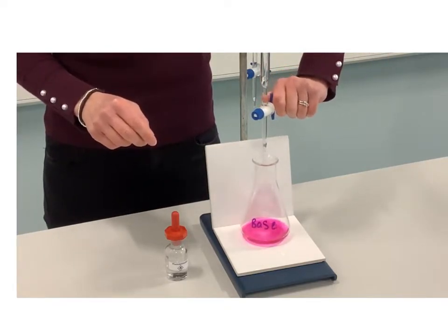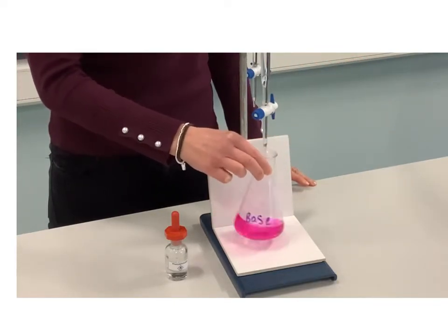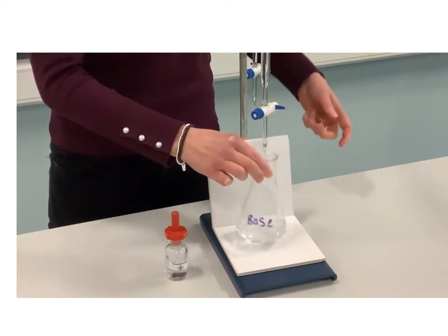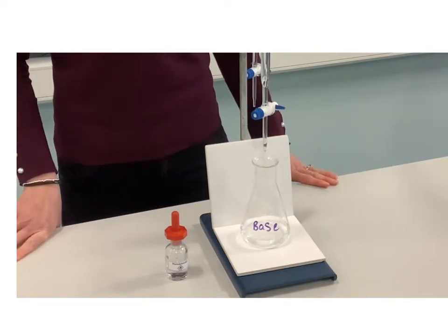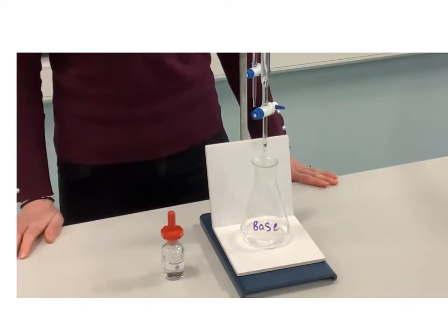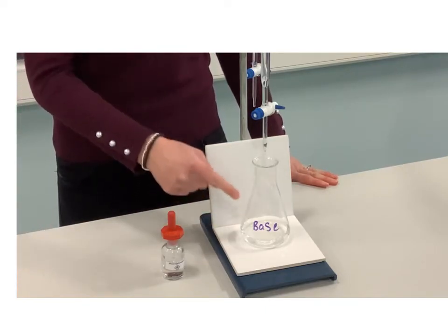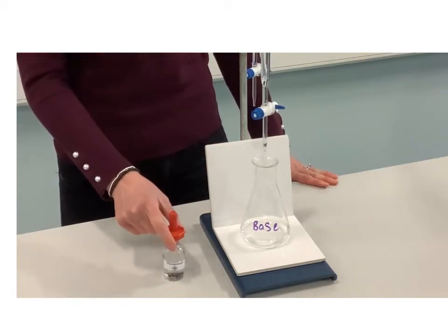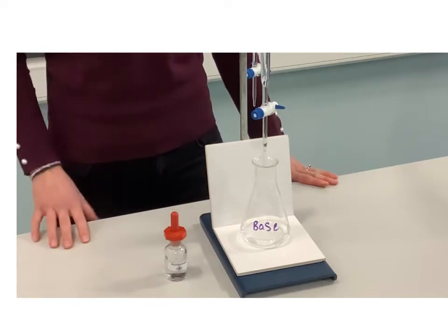I'll turn the tap so that the acid is now adding to the base. I'm not doing this as an accurate titration — I don't want to necessarily measure the volume required to neutralize my base — we're just demonstrating the color change. You can see the pink color has disappeared and it has turned colorless. So the color change when we start with base in our conical flask and add acid to it with phenolphthalein indicator is pink to colorless.